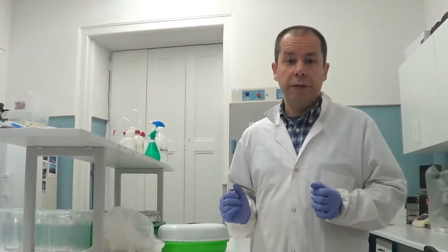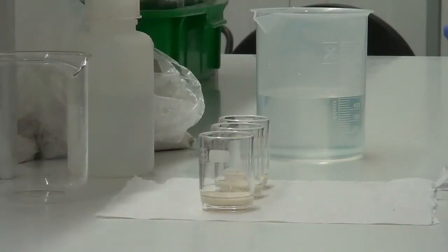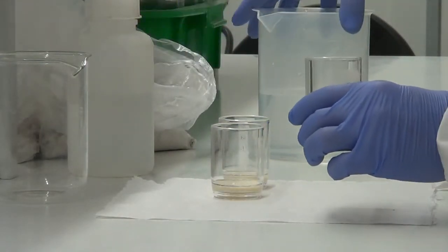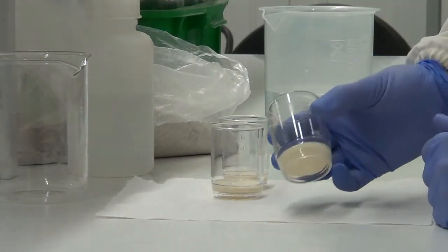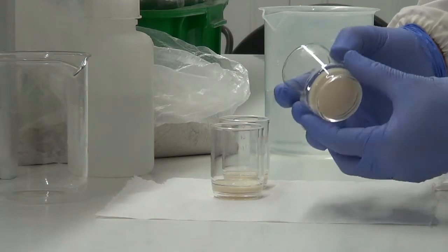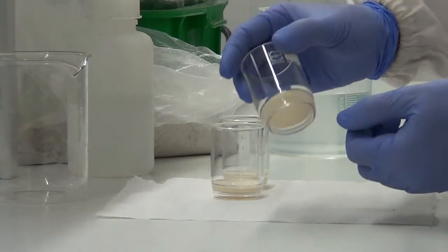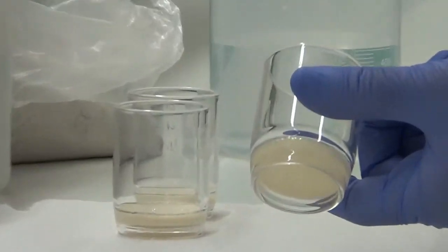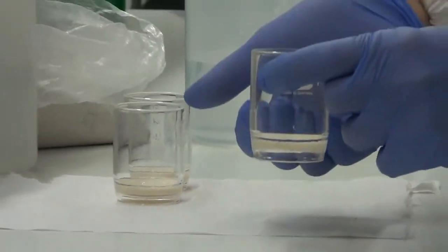How can we measure the water holding capacity of a soil? We have here an artificial soil as an example. We use these glass crucibles, and ideally we should use 3 replicates. These glass cylinders are open at the top, and at the bottom they have a filter with a certain porosity that retains the soil inside the cylinder and lets the water enter from the bottom to the top.